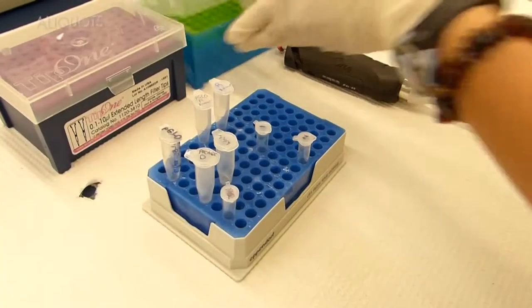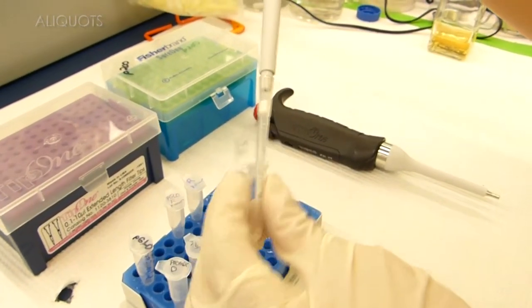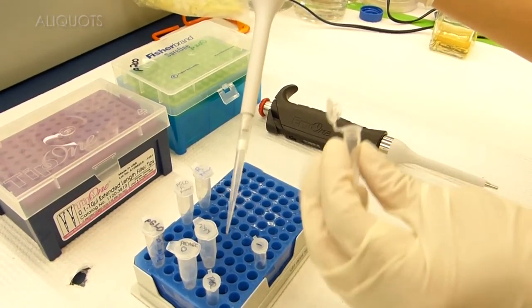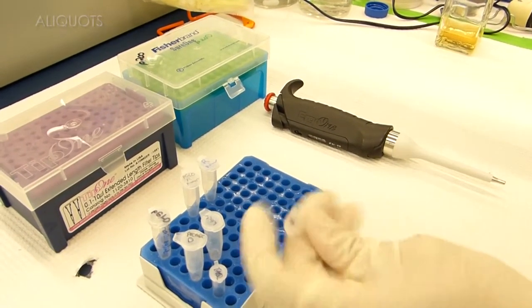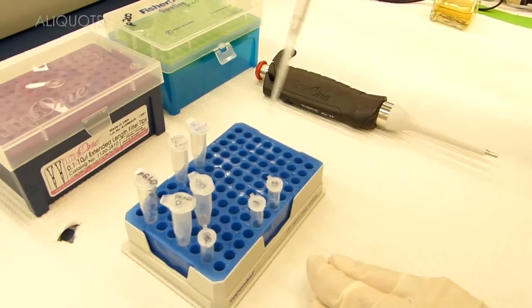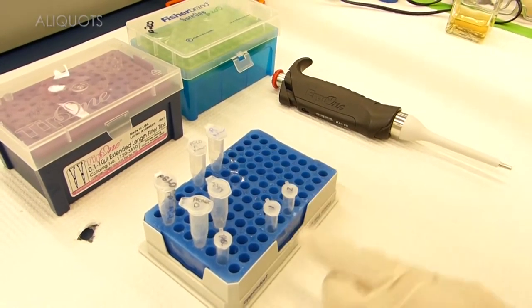So now we're going to make our aliquots from our master mix. For doing PCR, you'll want to follow pretty much sterile technique. You'll use sterile pipettes — notice that these pipettes have a barrier filter, so they can keep particles that could contaminate your PCR out of your tube. When we take up the liquid from any of these tubes, we don't touch the tip to any other portion, and we generally keep it inside the tube, which is the sterile portion. The outside is not sterile.